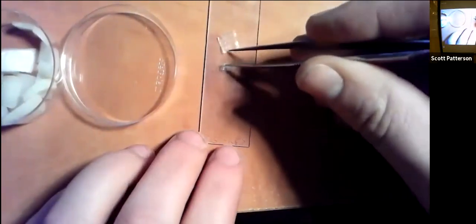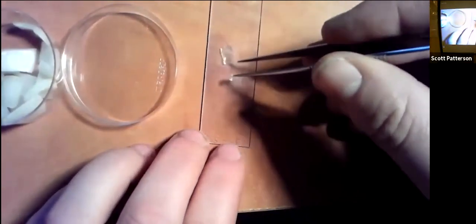When you do that, you need to try your best to make sure, see how it's nice and flat? It didn't get folded up and whatnot. If it's folded up, remember, we have to shine light through it. If you have it folded up, you're gonna be looking at two layers, three layers of cells. It's gonna be a mess.